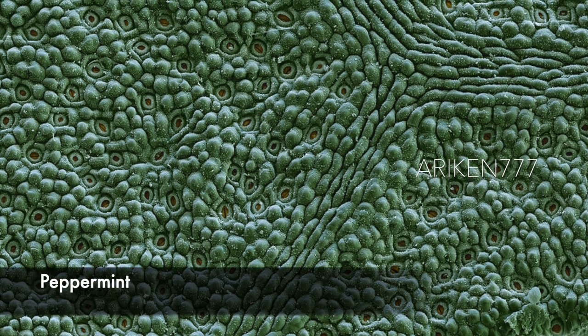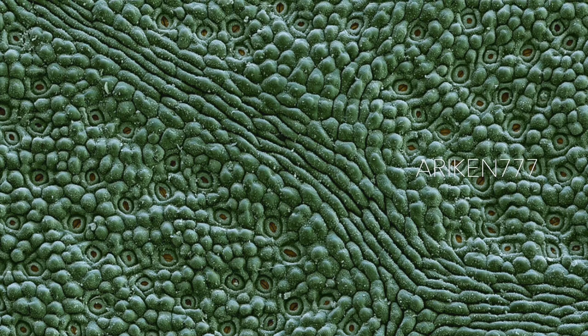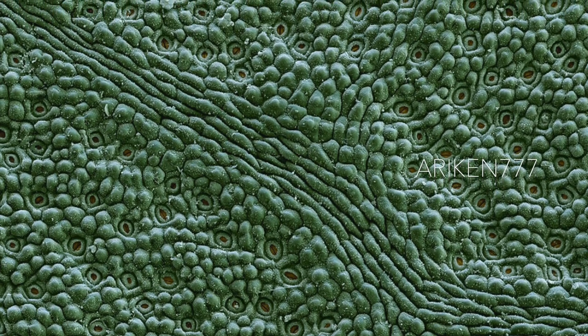A Mount Wellington peppermint. This eucalyptus species dominates the dry forests of Australia. To protect itself from desiccation, extreme cold and frost, a layer of wax coats the surface of its leaves. These evergreen plants also secrete oils and are used in herbal medicine. The picture shows the leaf underside coated with wax and leaf pores.